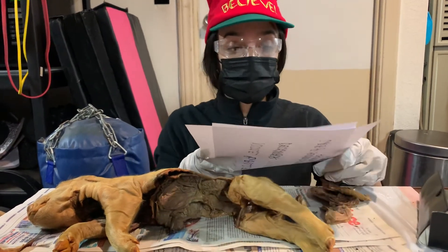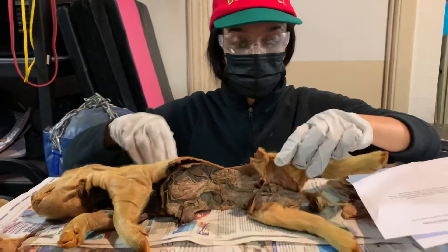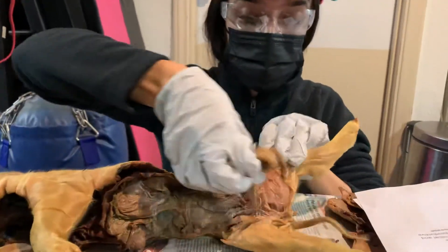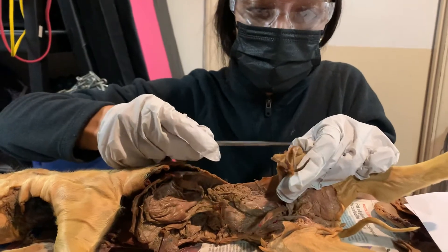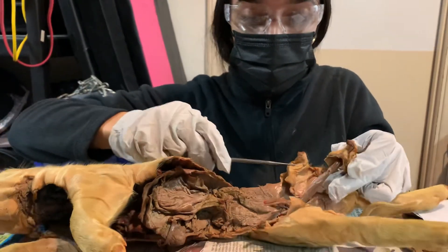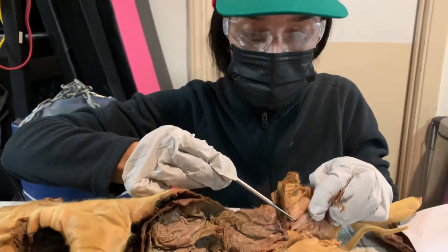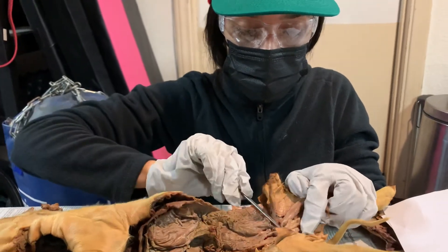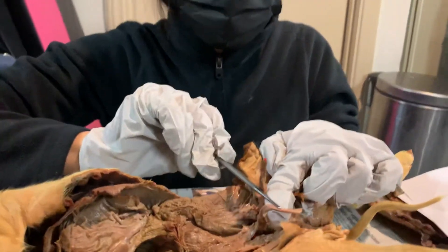I'm first going to show you the umbilical cord. The umbilical cord is located right here on the outside, and on the inside you can see the umbilical arteries right here and right here.